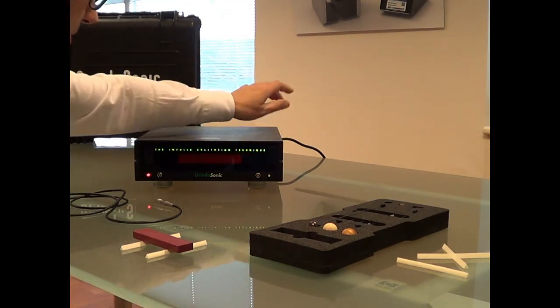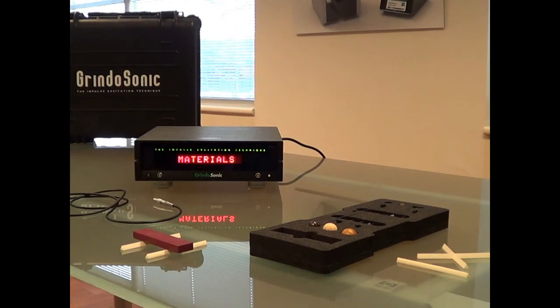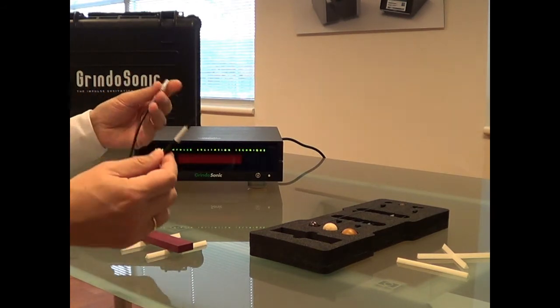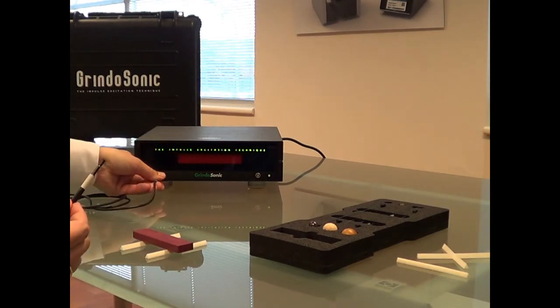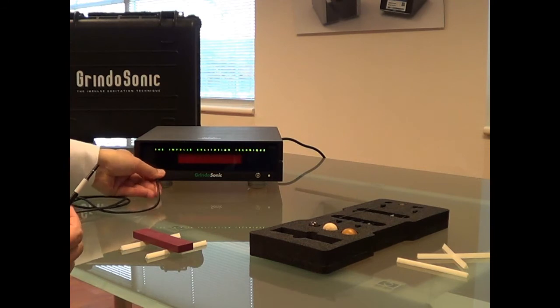We just switch on the system. You get the initialization procedure. Then we have the measurement probe, which we connect into the device with the red dot on the upper side.